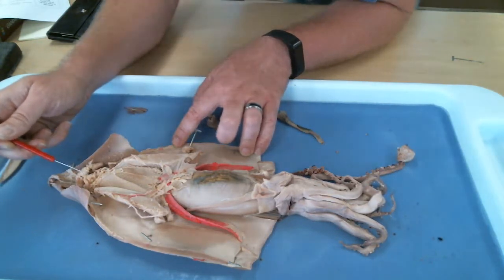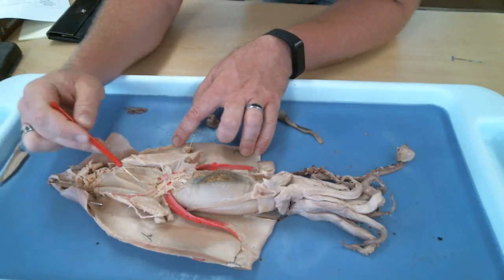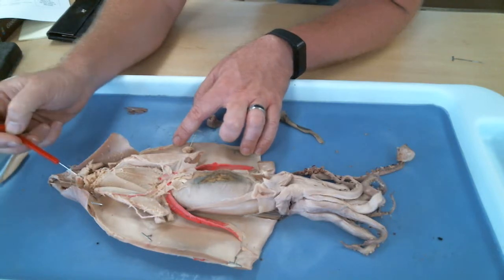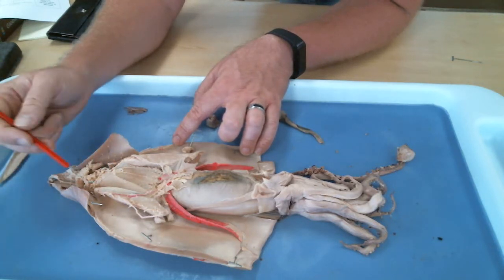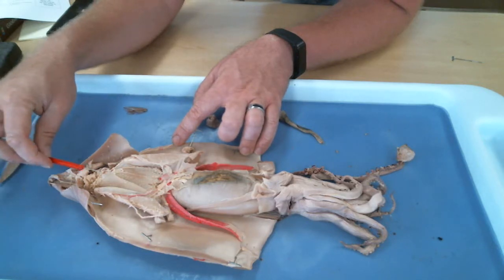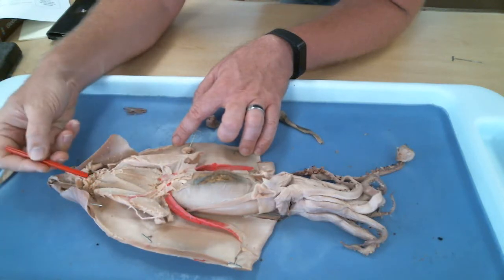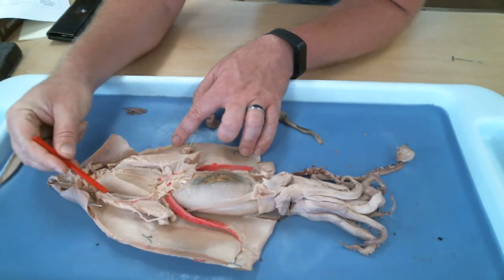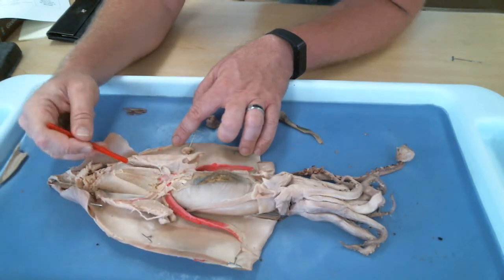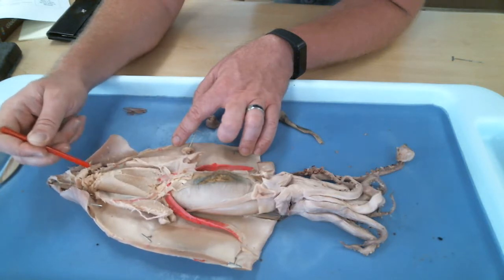You see this in the video? Yeah. You can see all the eggs, and the eggs have kind of stuck to the inside of the fins and the cavity here. Hundreds and hundreds or thousands and thousands of eggs that were in this squid. The squid will lay an egg case, so she was building up an egg case to get ready to lay them. The way that they mate, and this isn't going to be on the test, it's just kind of cool, is she'll build this big egg case here that is just chock-a-block full of eggs.